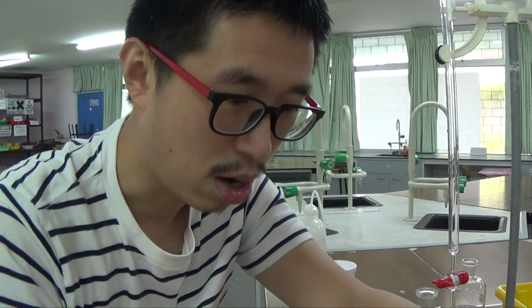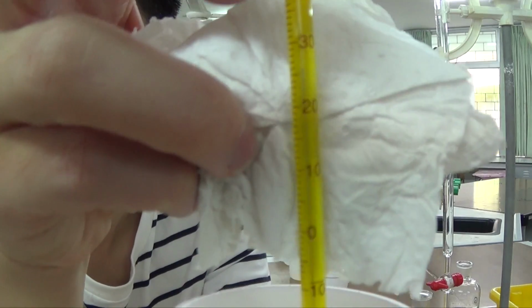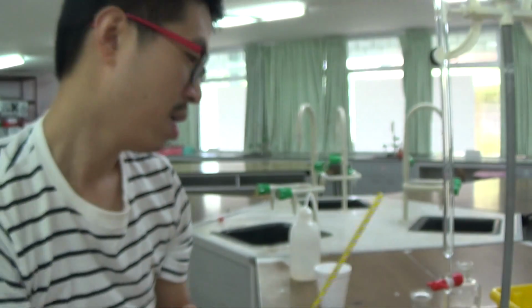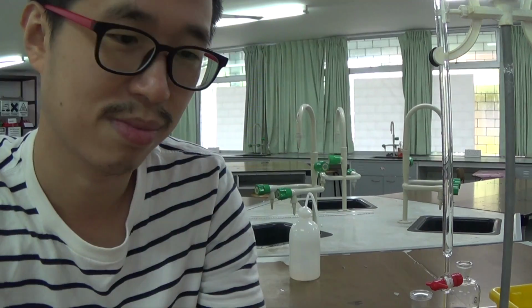Let me just lift that up so that you can see it clearly. I'm gonna hold it against these backgrounds and hopefully you can see it. Nope, that doesn't help at all. Does it help? Maybe not. Okay, it's 26.0. I think the white background helps a bit better. I should really grab a white towel, I guess.